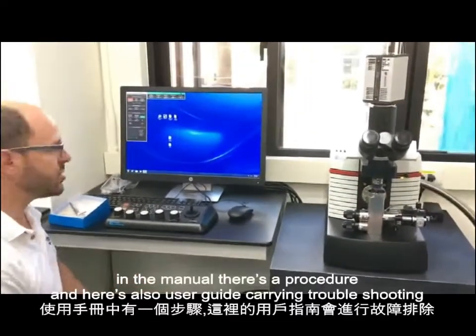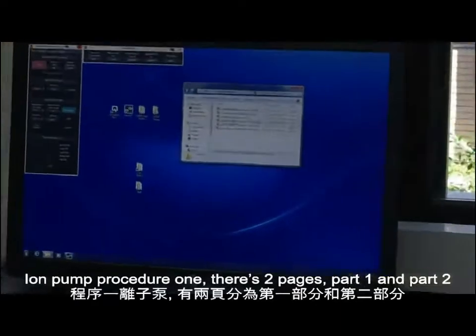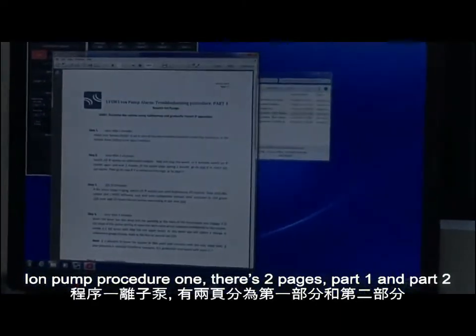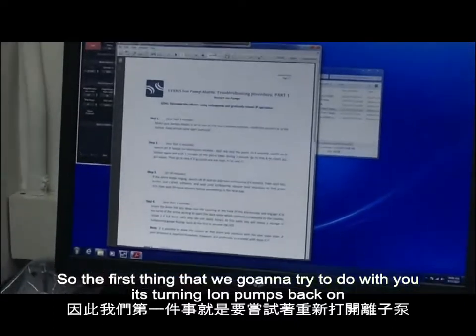In the manual, there's a procedure, and here there's also a user guide, care and troubleshooting, LVEM Ion Pump Alarm Procedure 1. So there's two, there's part 1 and part 2. Part 1 is restarting the ion pumps, okay? So the first thing that we're going to try to do with you is turning the ion pumps back on.